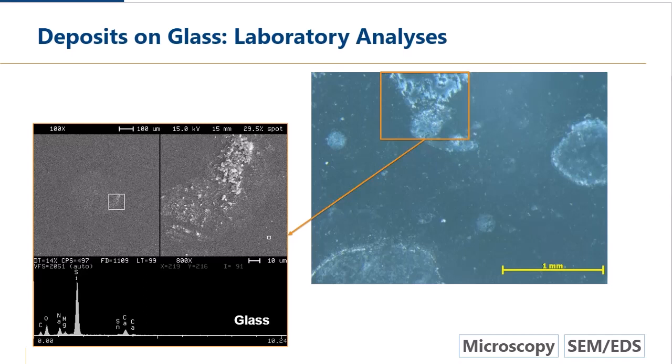And then my favorite feature of the SEM is you can really pinpoint an area and get some elemental analysis. So at the bottom, you see some peaks, and each peak or each set of peaks is associated with an element that's present in that given location. So in this particular sample, we're looking just at the glass itself, away from the deposits. And we see silicon, calcium, sodium, oxygen. We see basically soda lime glass. So this is the typical kind of architectural glass composition that you're going to see in buildings all over the world. But now we want to look at the deposits.